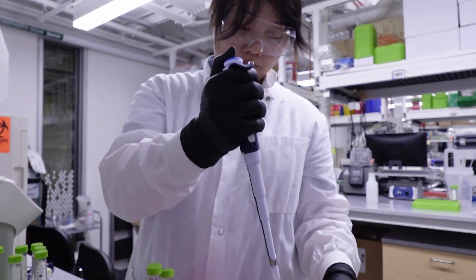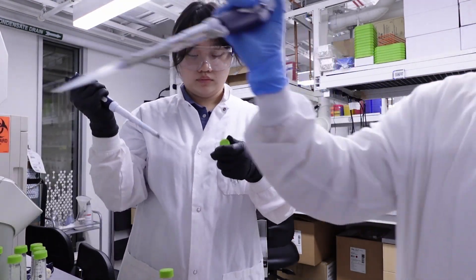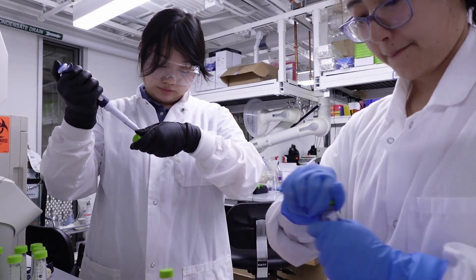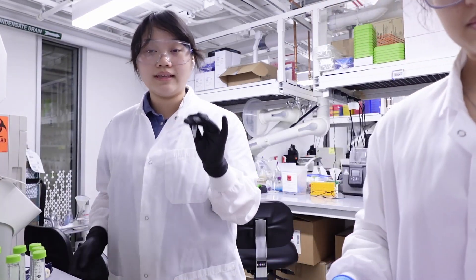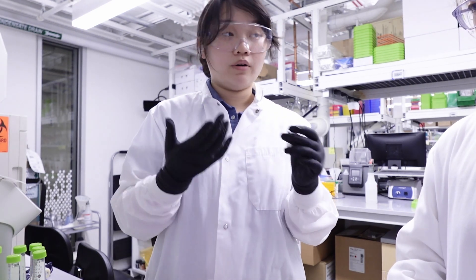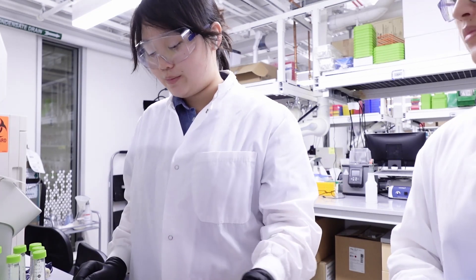Because we might shear the DNA. Like once it's been lysed, you don't want to pipette up and down — like when it precipitates out, don't do it. Probably to be safe, don't do it in the blue part. Like whenever it says invert, just invert it. This is going to lyse the cells. Lyse means to break. So after this step, the cells are going to be broken, and we are going to be able to access the cellular components after the membrane has been broken.